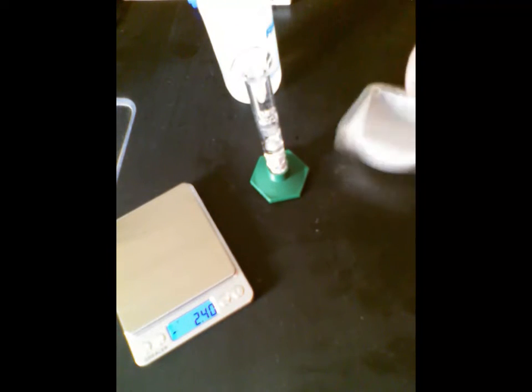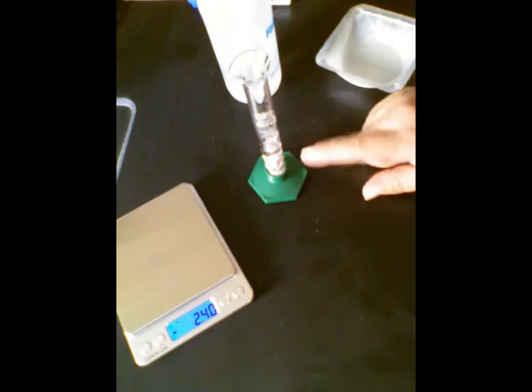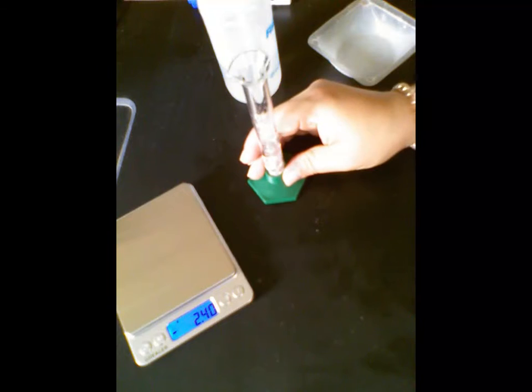So into my graduated cylinder, I'm going to dump those pieces of aluminum. I should see, as I'm dumping them, the water level rising. My volume has increased here on my graduated cylinder. Let's see if we can get you to see this a little better. Do you see where our volume was at 4 down here? We added these aluminum pieces to it, and now if I read from the meniscus, it looks like it's perfectly at 6. So the aluminum that I added is 2 milliliters.